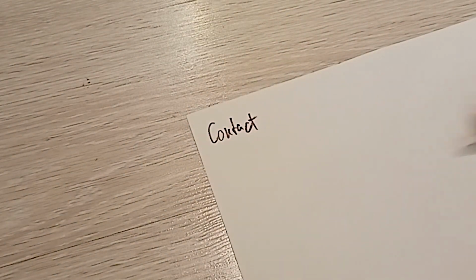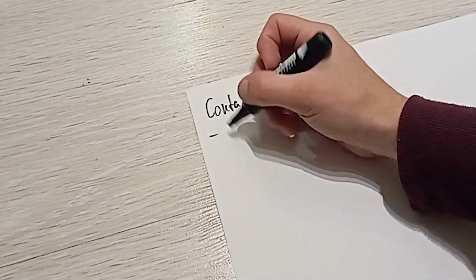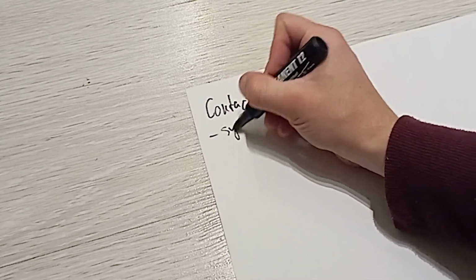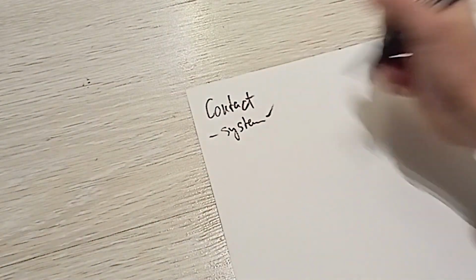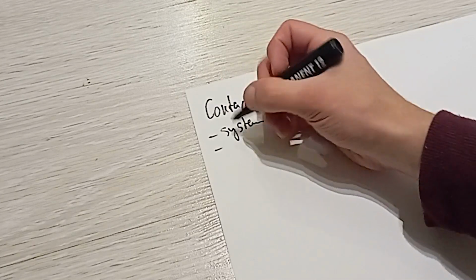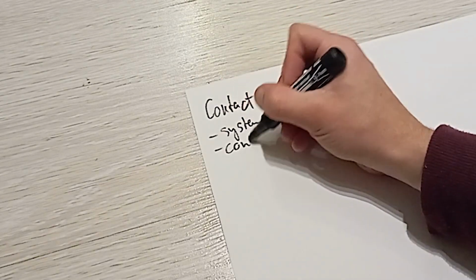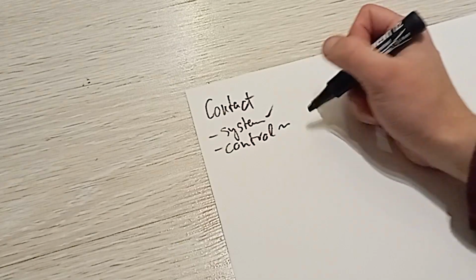And there I am doing a few things. Probably you know that I have done this system. Basically, the system is done. What has been left is the temperature, basically the control. That's not yet done.